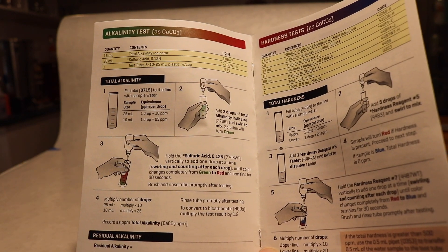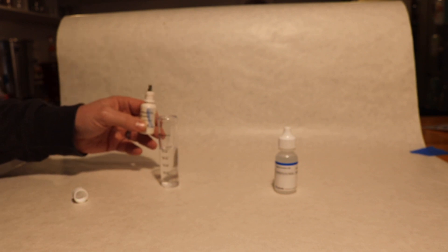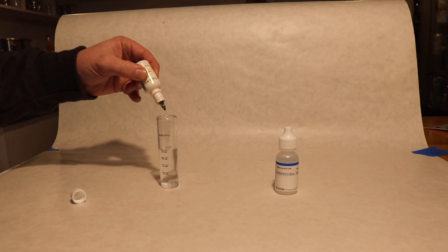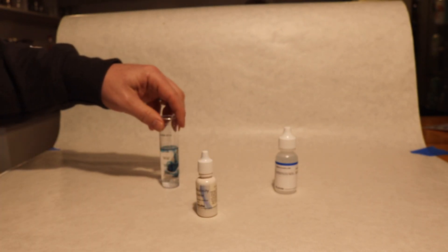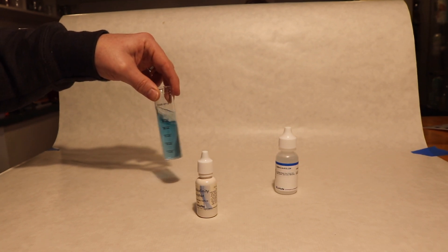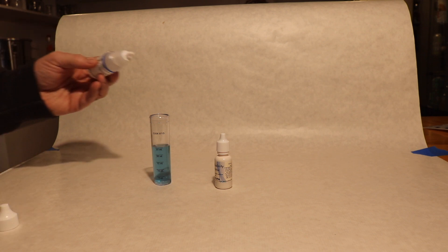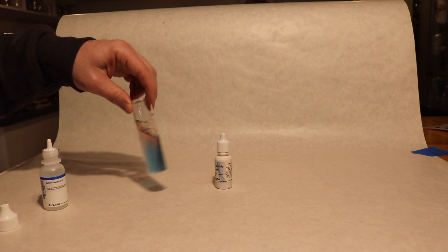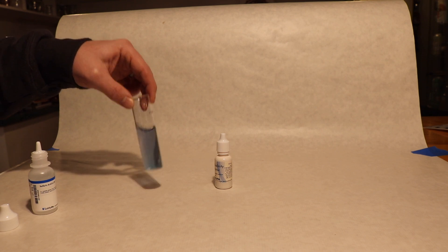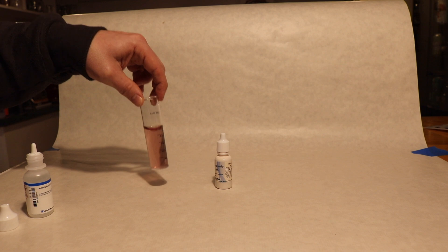This test is for total alkalinity, quantified as calcium carbonate. It's a cool test where the solution goes from a greenish-blue color to a red color. You add three drops of the total alkalinity indicator, swirl it up, and then add the titrant drop by drop. You can see at the surface it starts to turn red, then you shake it and the redness goes away. You just keep going and counting drops until you get a nice solid red color — that's your positive result.